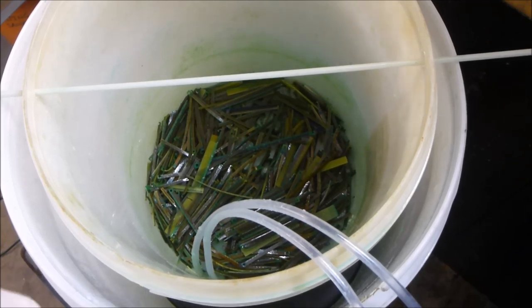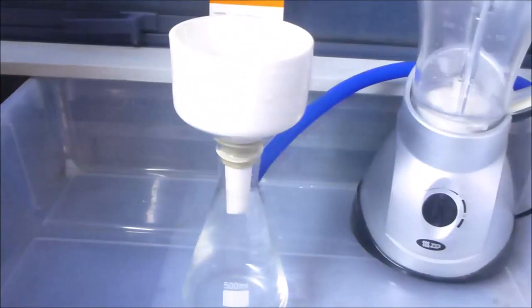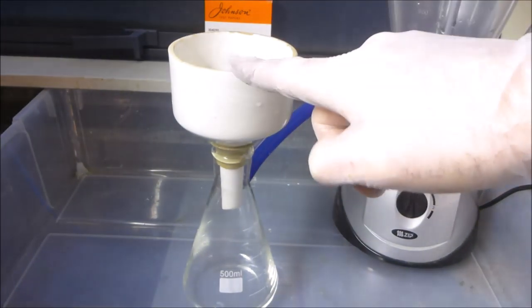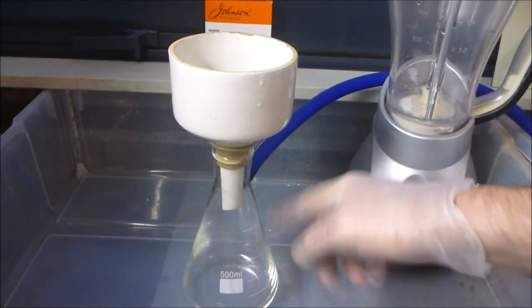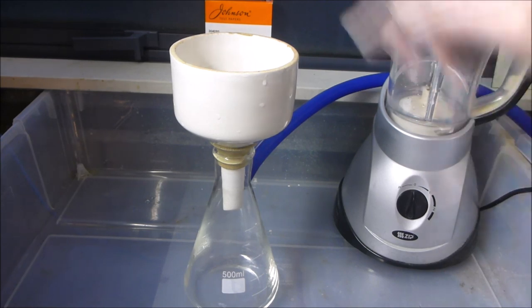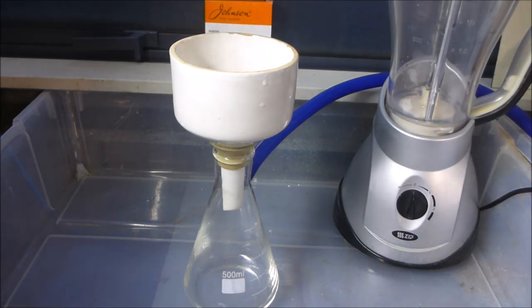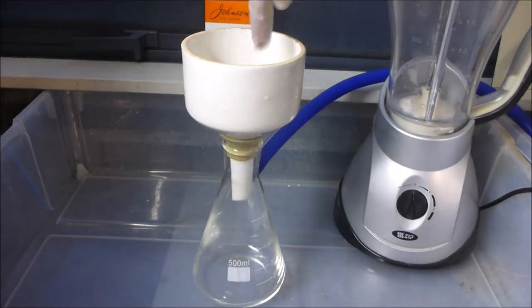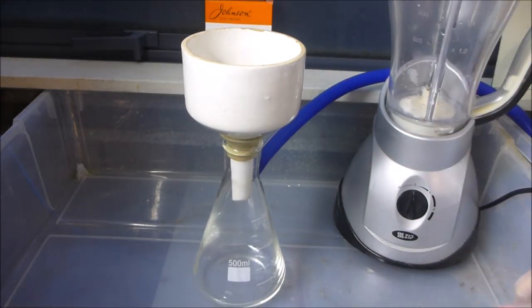So generally, if we pan this way and we zoom out a bit, normally I just use my Büchner funnel and filter flask, with, you see, the vacuum line connected to the back, and I've got a vacuum pump just off the side here. Now that works relatively well, although what pretty much happens is eventually the little holes in there, that's basically where all the filtration is happening, the filter paper blocks up and you end up basically running at a few drips if you're lucky.